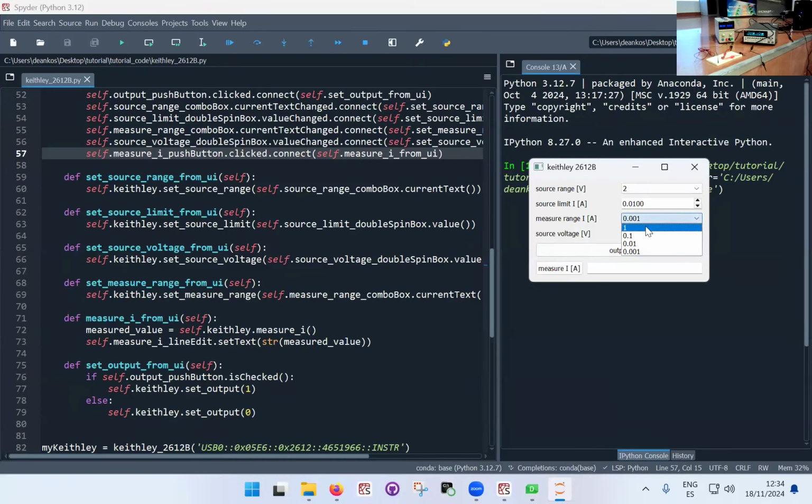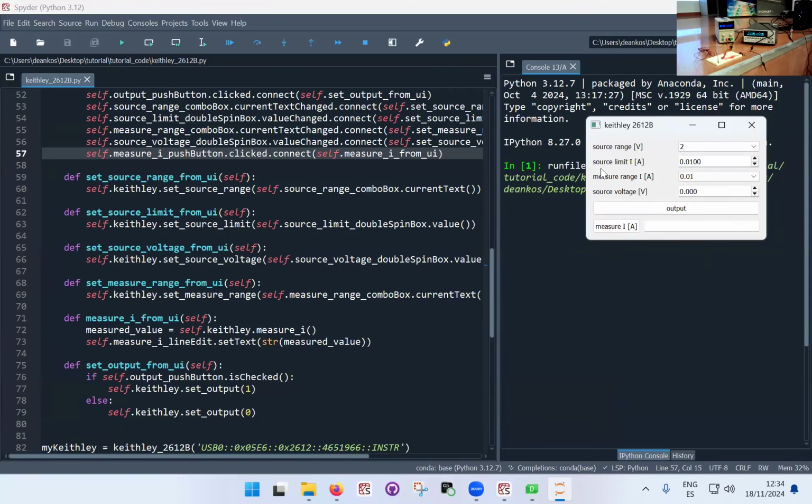So measure range. You see, this is in amps now. And as I change it to different ranges, it will drop. I guess it's mirrored the whole thing. Oh, it's a big mess. Well, anyway. Clearly, amp mils is not what you want. It's milliamps anyway. Stuff is changing. It's just the whole thing is mirrored. I can probably change that somewhere, but I'm not sure I'm bothered. So I'll just leave it as it is.